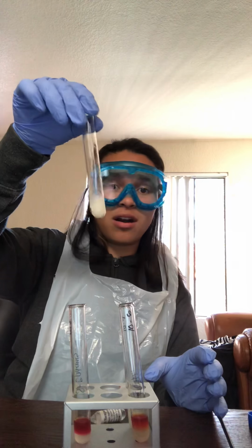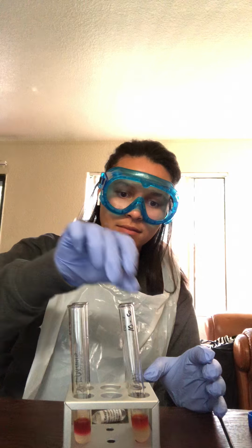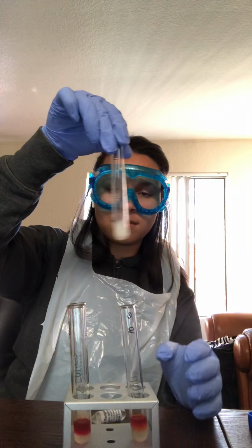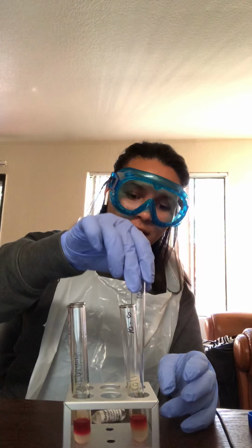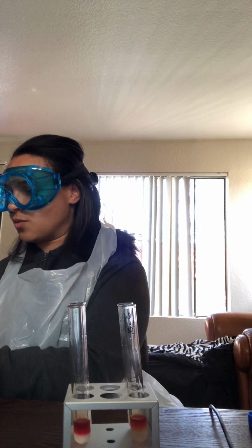It has a really strong smell. And then swirl. A little bit of color change. It's a lot more cloudy than it was before. Now the last step is to add the Barritt's B reagent. So we'll do 4 drops into each one. We're going to kind of shake it, expose it to a little bit of oxygen, and then I'm going to let it sit for 30 minutes, and then we're going to record what we see after that.